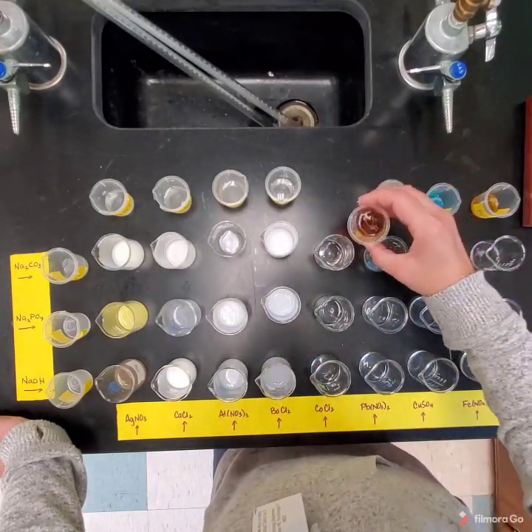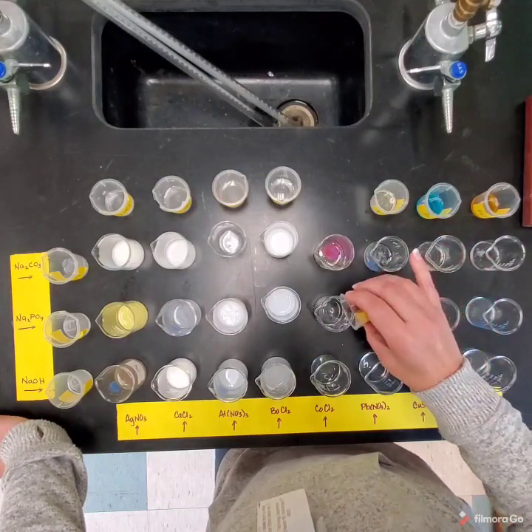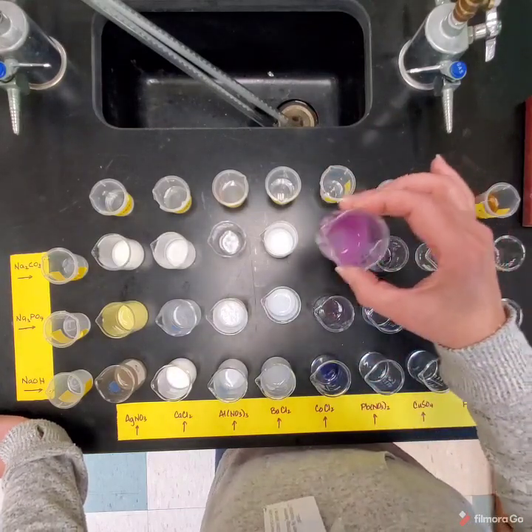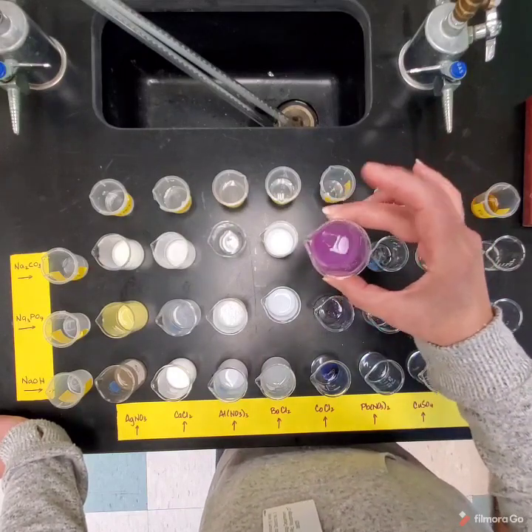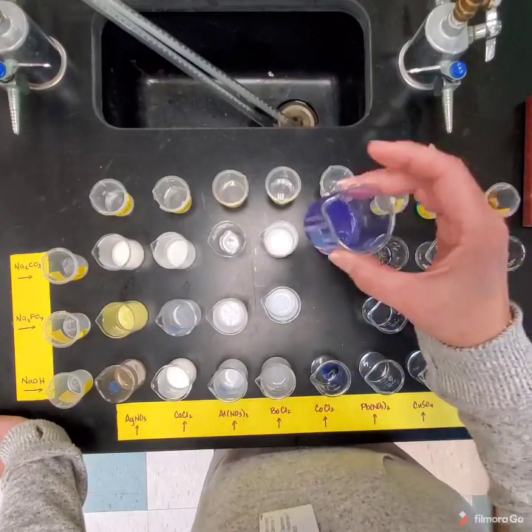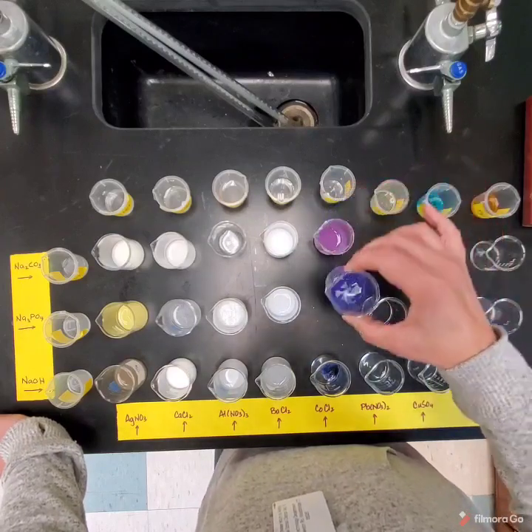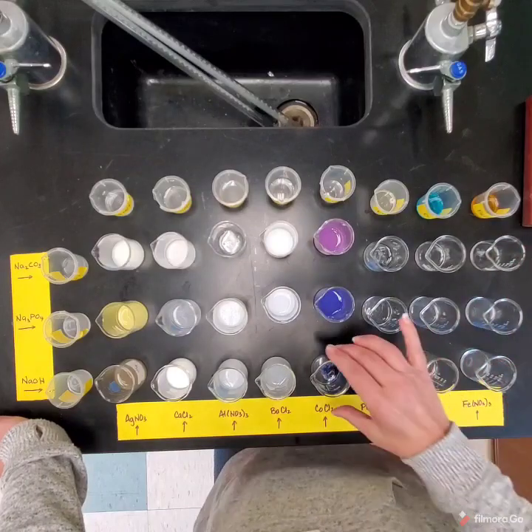Okay, cobalt chloride. We're getting some colors other than white now, which is kind of nice. Okay, so here we go. Now when we get to elements that are in the transition, look at that one. Nice pretty color, purple. And it is kind of, it's a little goopy. It's a little gel-like. You get pretty colors when you deal with elements that are in the transition.